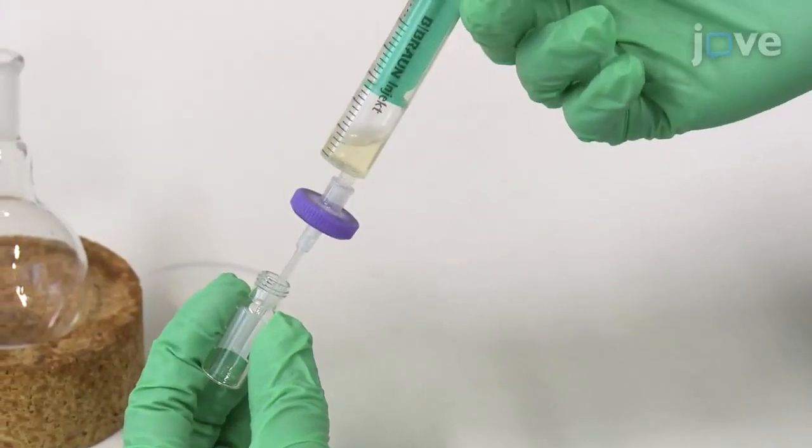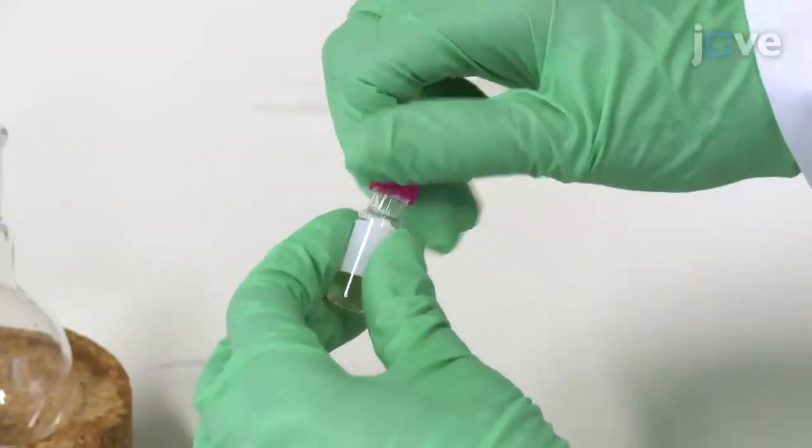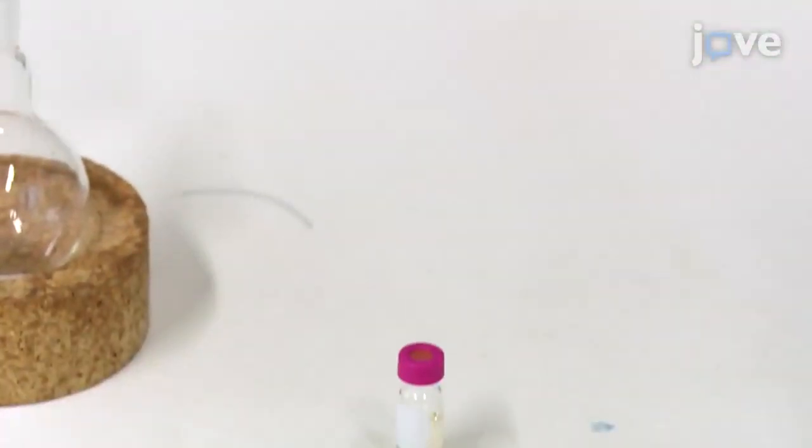After this, filter the solution through a syringe filter. Store them in a vial until ready to perform non-targeted analysis by HPLC-ESI-QTOF-MS.